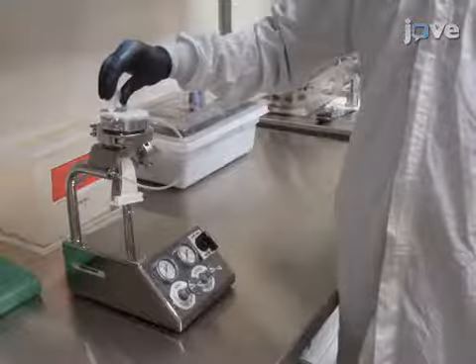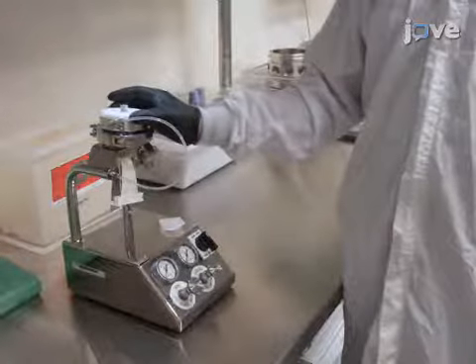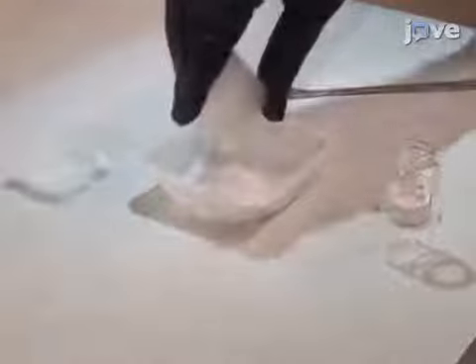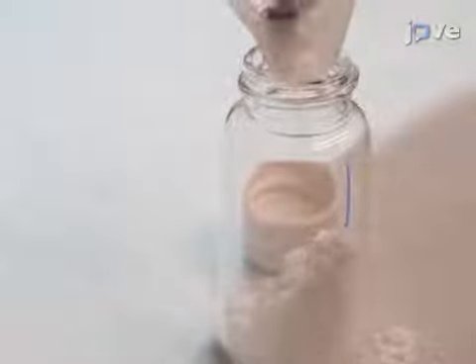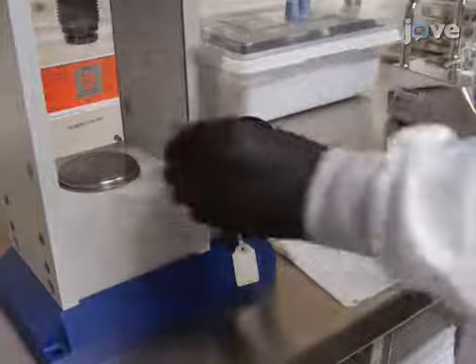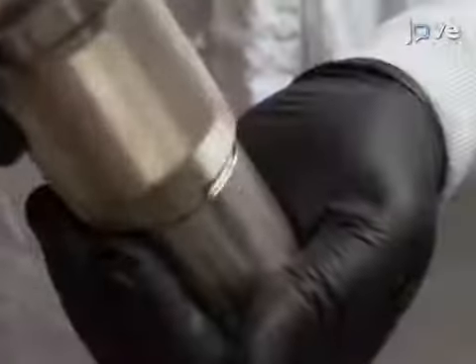For dry powder aerosol generation, first use a jet mill to micronize the dry drug powder, taking care that the micronized particle size distribution contains particles of respirable size. Blend the potent test compounds that require dilution with micronized lactose. Then use a manual hydraulic press at approximately 1,000 pounds per square inch to pack the micronized drug into the cylindrical reservoir of a Wright dust feed dry powder aerosol generator to produce compacted cakes of powder.